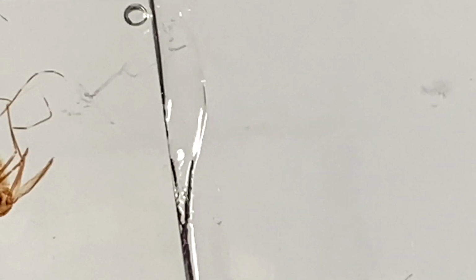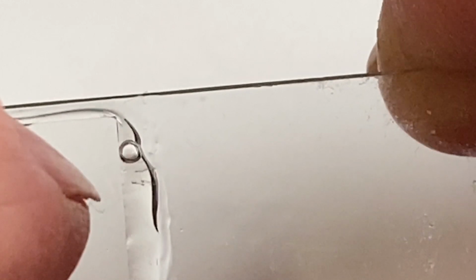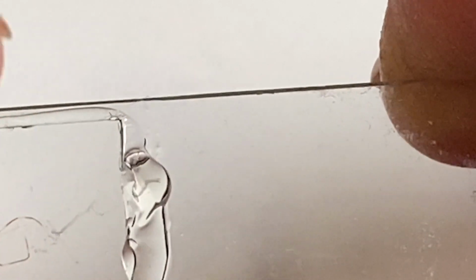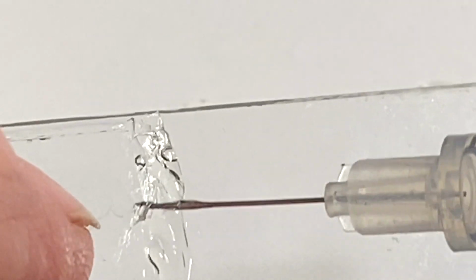Would you believe I just touched the tip of the soldering iron? Ouch. All right, so okay, the hazards of slide making. Here we go. So I pushed it out, see? Now, of course, notice how it's going to suck back in again. So I'll take this syringe needle, and I'll just scoop this away a little bit.